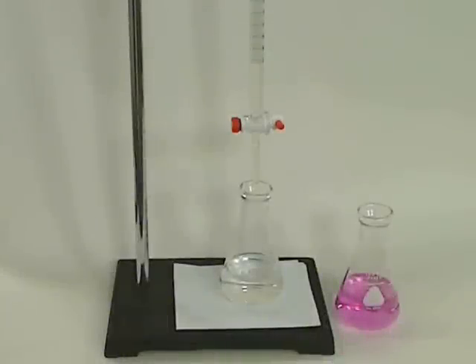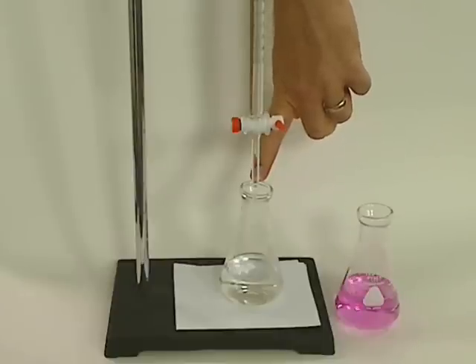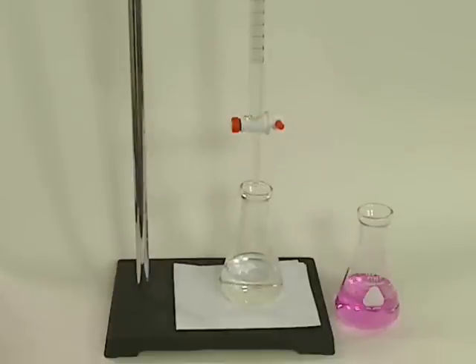We've explained the basics of using a burette and the fundamentals of a titration. Now I want to actually show you and perform a titration. This titration is going to be a strong base as the titrant up here, and a dilute solution of a strong acid will be the analyte, which is in the Erlenmeyer flask.